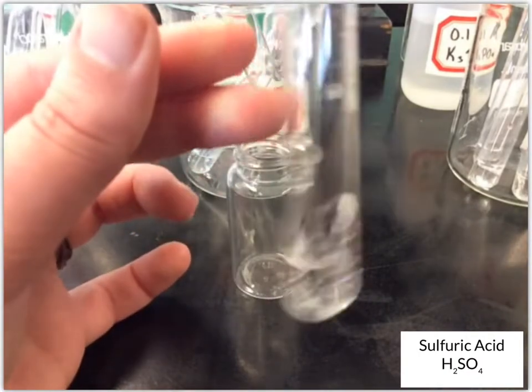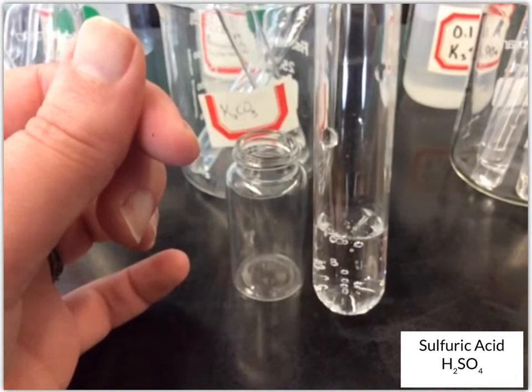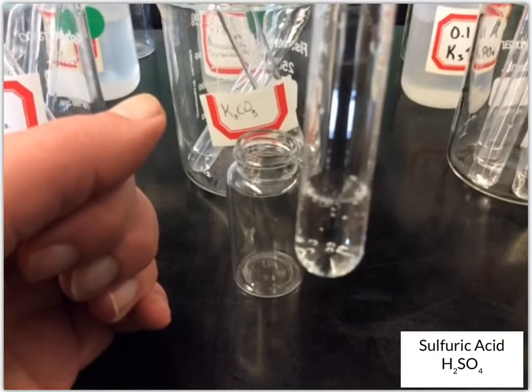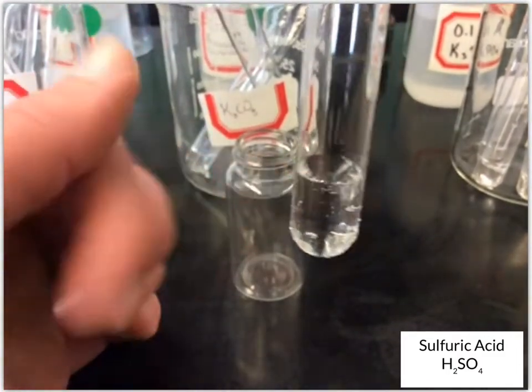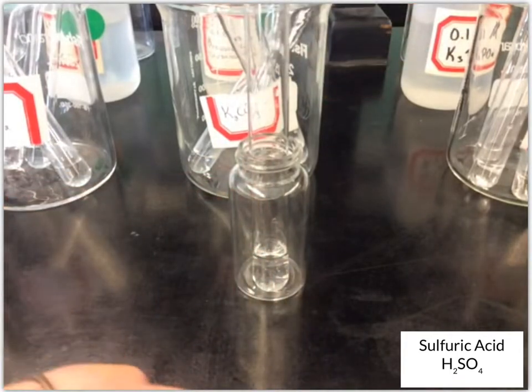If you're watching closely, you should have seen bubbles forming, and they're still forming. It's kind of slow, but those are actual bubbles being formed by that mixture of the K2CO3 and the sulfuric acid. So that one had bubbles form.